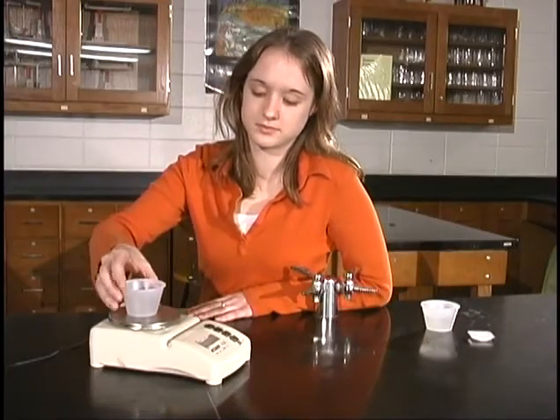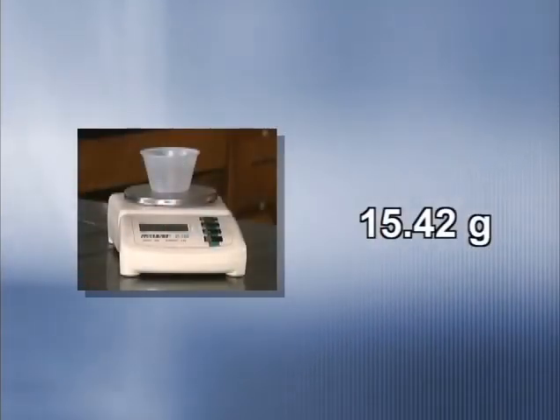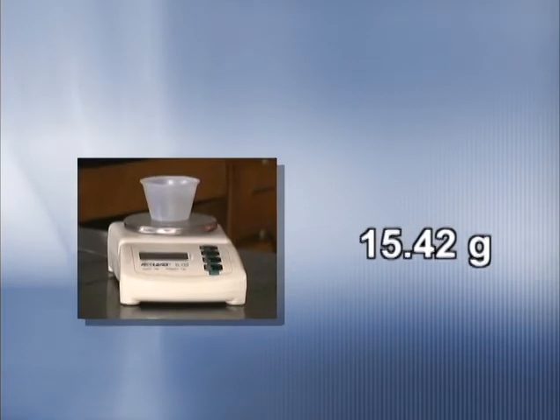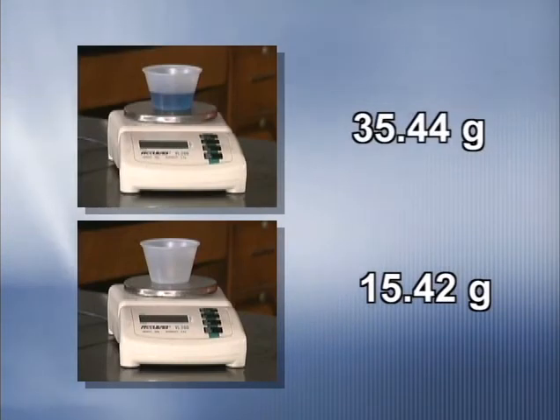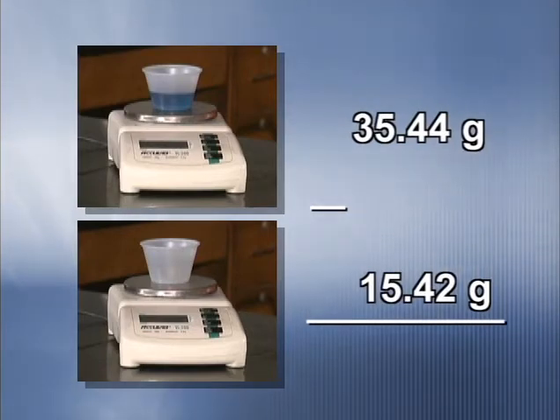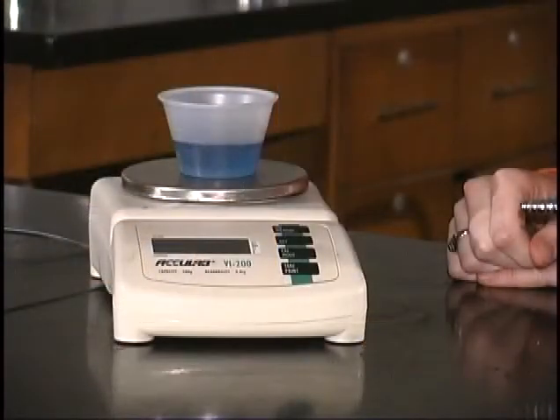What if we take this other cup and measure its mass first? The mass is 15.42 grams. Then we could pour my water into that cup and mass it again. The new mass is 35.44 grams. By subtracting 15.42 grams from 35.44 grams, we would have found the mass of the water. The mass of the water would be 20.02 grams. Yes! I agree that this is an excellent way to find the mass of water in this cup. However, our digital balance makes it even easier for us.